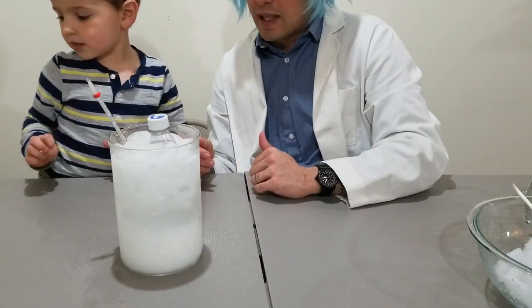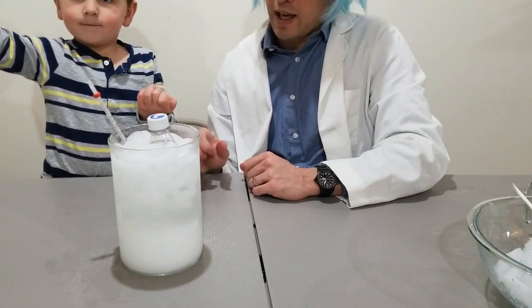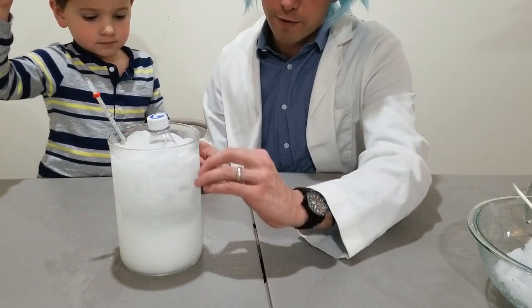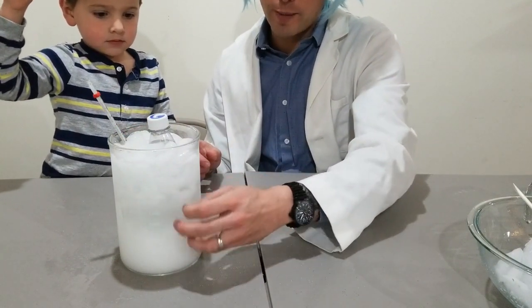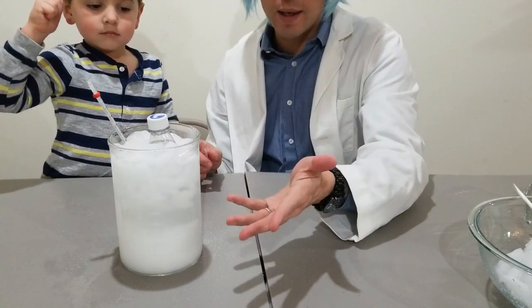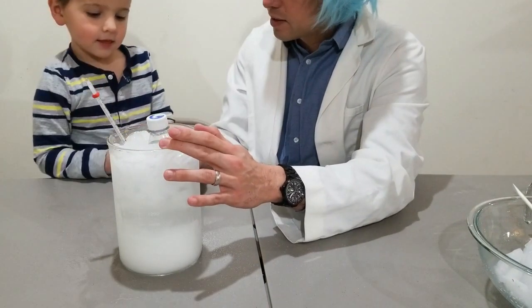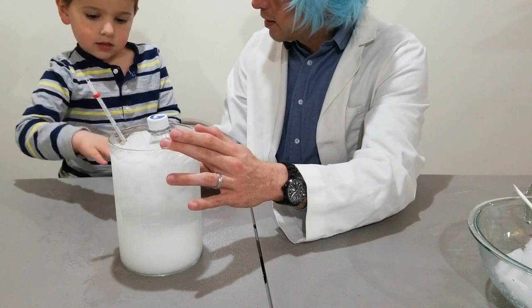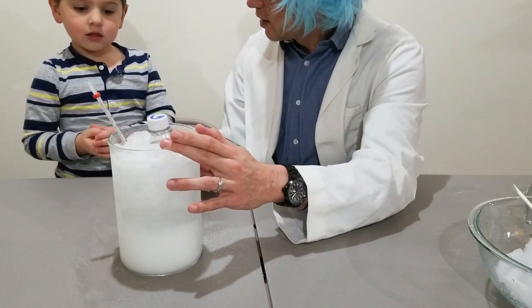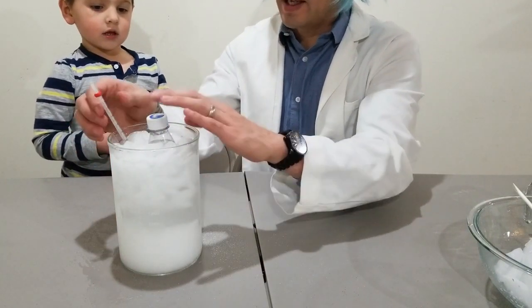Okay, so we've been at this for a little while and some interesting things are happening. We've got some frost, some ice forming on the outside of the beaker. Normally when there's a cold drink you just get condensation, but here we have some frost forming on the outside.